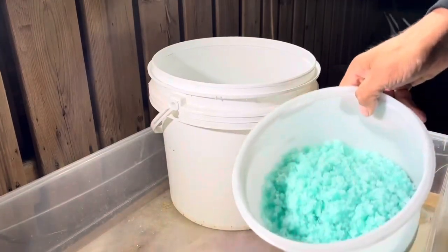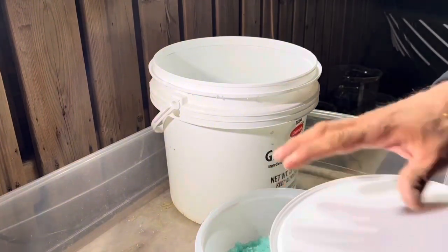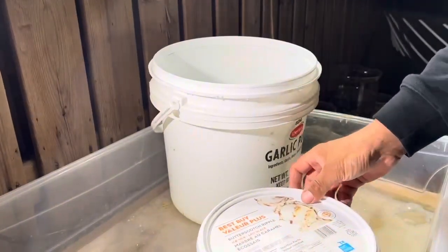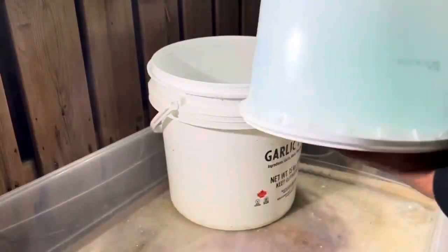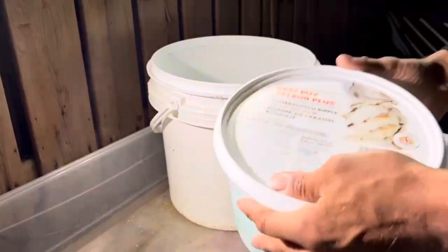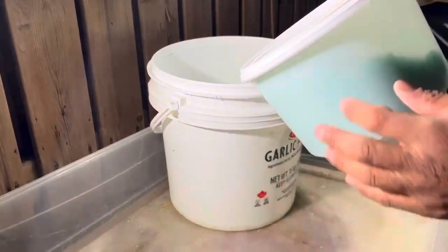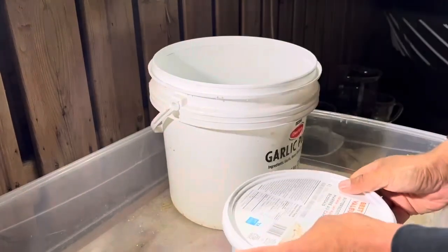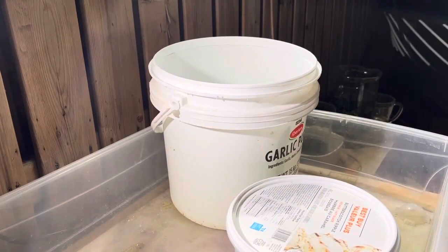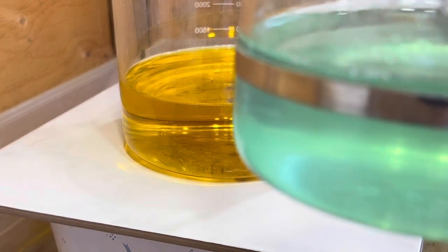It's still a little damp, but I'll put a paper towel here and then put it upside down to dry a little more. I don't want to leave this open or it's going to turn brownish — that color is not ideal. This is now ready for precipitating gold using copperas.